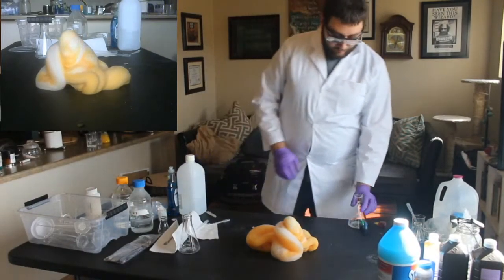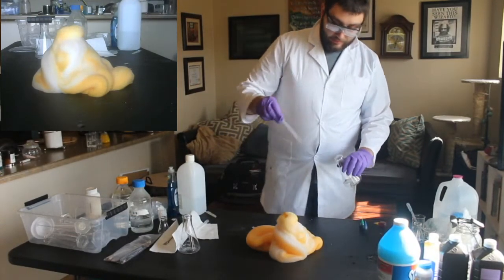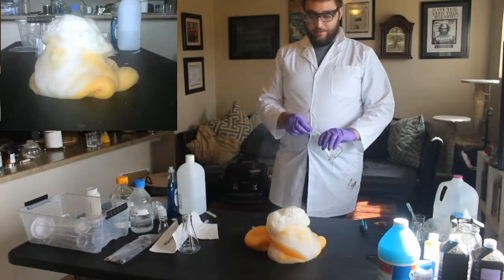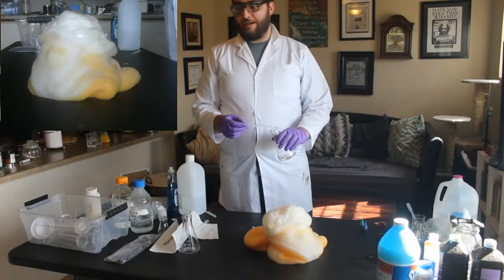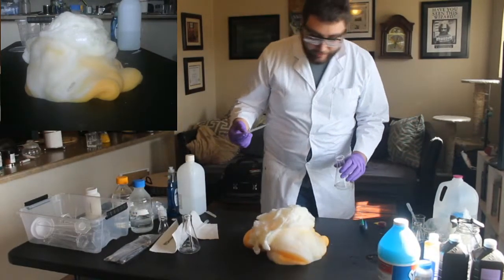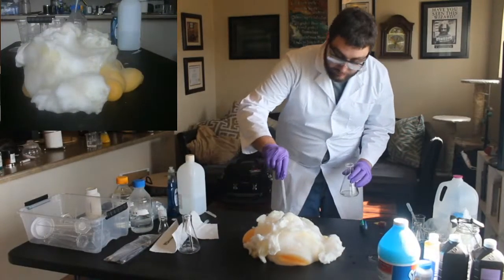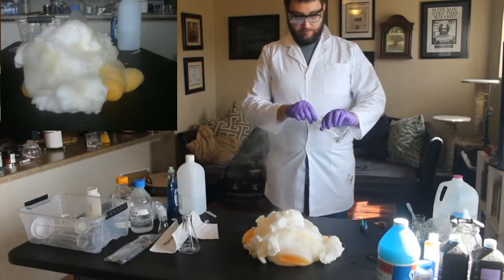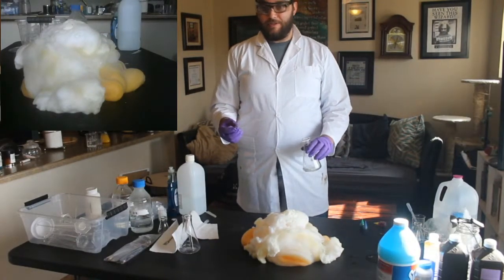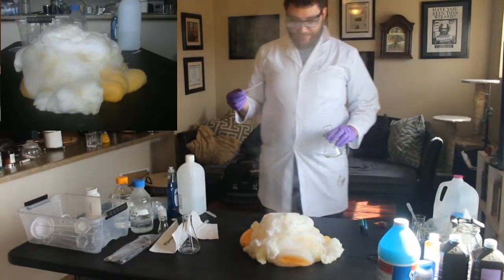So now, maybe we switch back to potassium iodide. Maybe we have... Yeah. There we go. So we're creating even more foam and steam. So much so I don't know where the top of this is to add more stuff. There it is. There's that big gust of steam. Oh, that close-up camera looks really good. At this point, I'm just guessing.